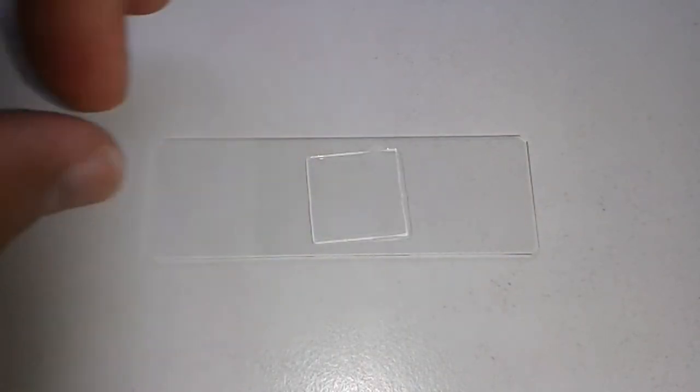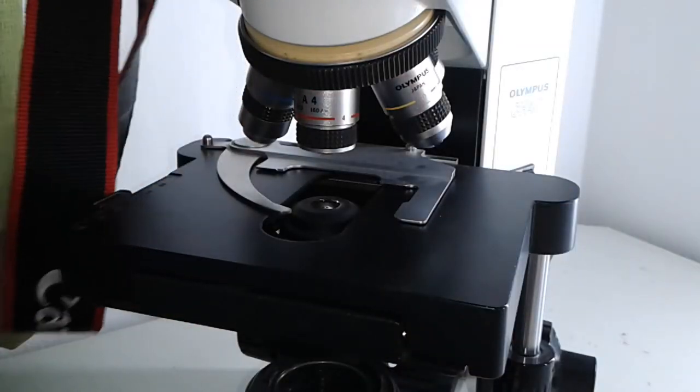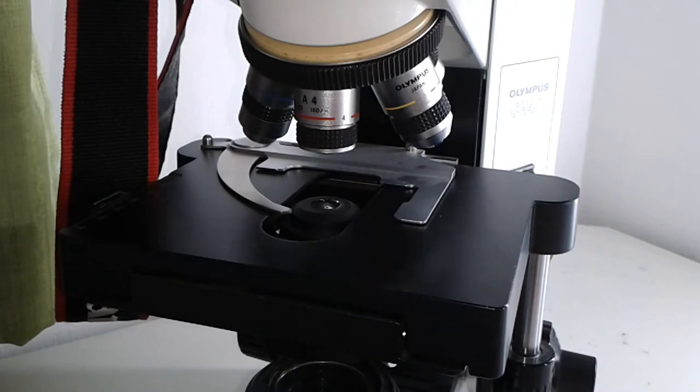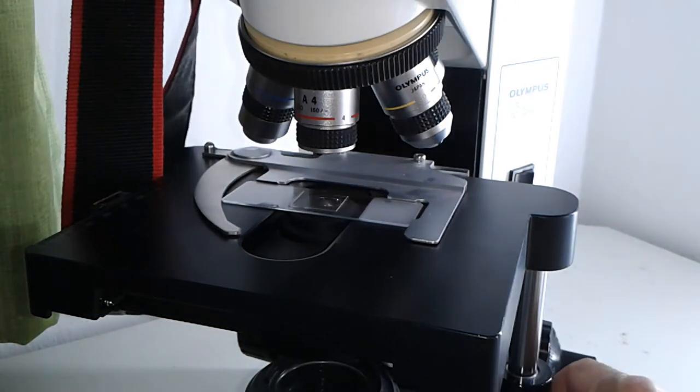And then everything goes under the microscope. So it goes under the microscope. And then let's see what we find.